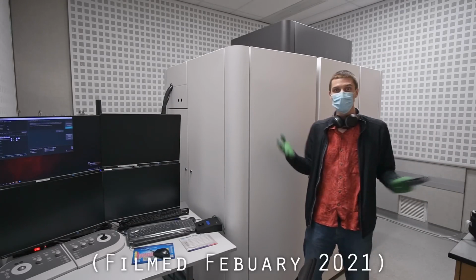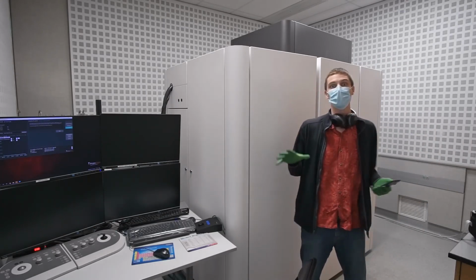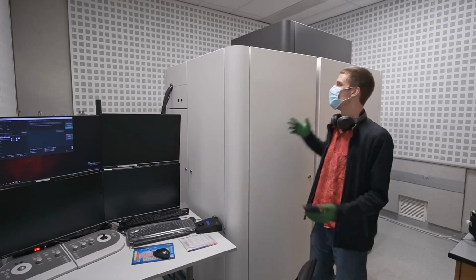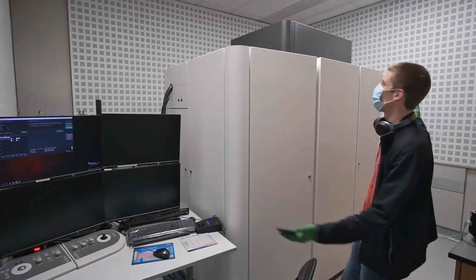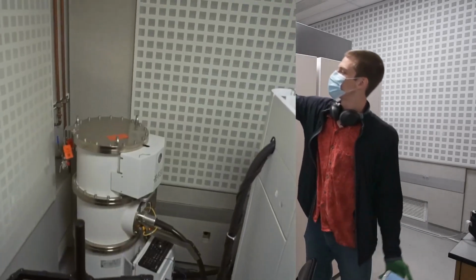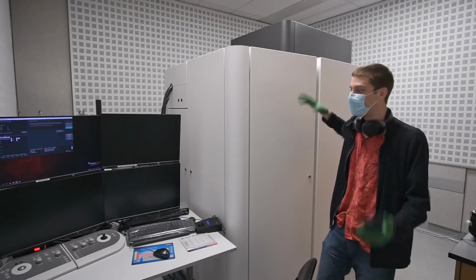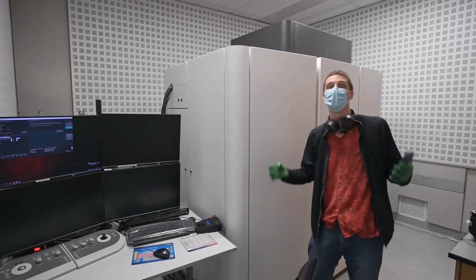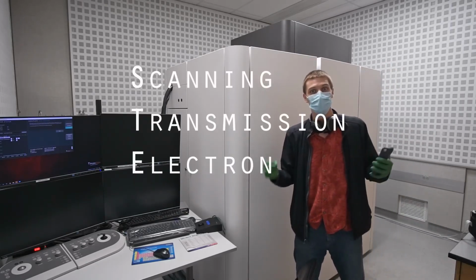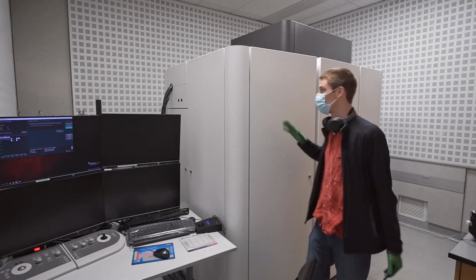I am back in the microscopy suite in the materials department at UCSB, and I'm going to show you some atoms. So this huge, car-sized box, and these 4 monitors, the huge cylinder behind those 4 monitors, and some more equipment that's behind that back wall, together constitute an instrument called a scanning transmission electron microscope, or STEM. And today I'm going to show you exactly how this works.